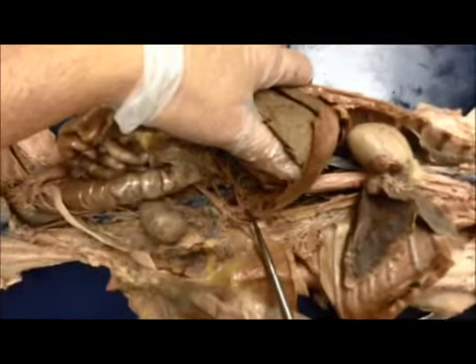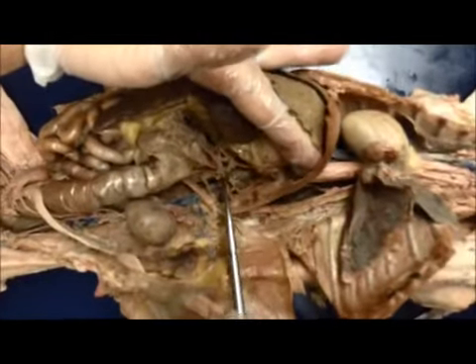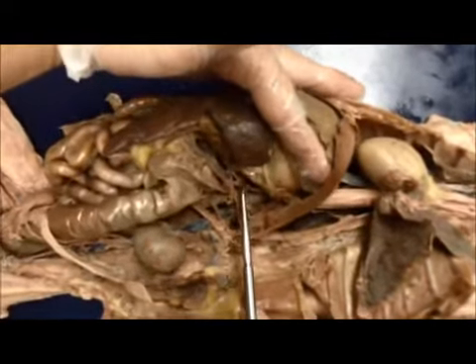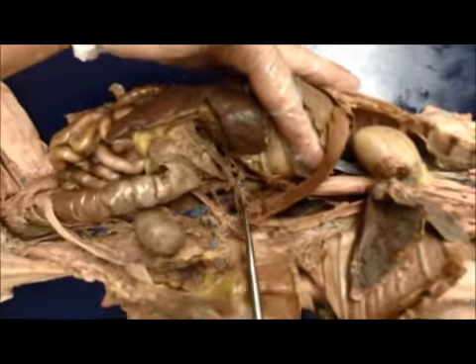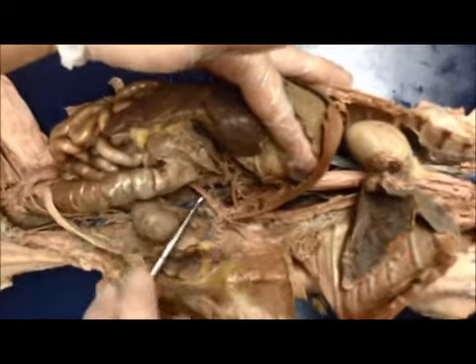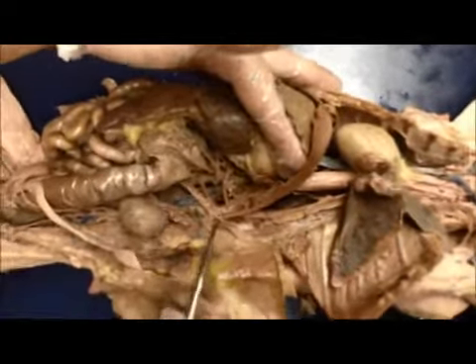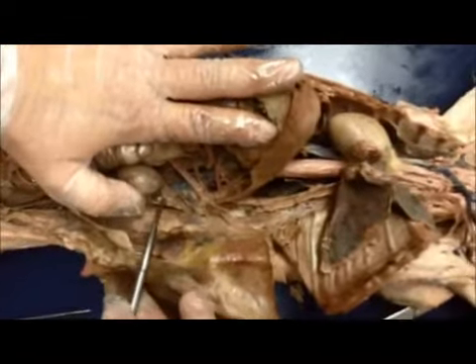This is the celiac trunk. From the celiac trunk, it goes up here. It branches to the right. The first one is the hepatic, then the gastric, we're talking arteries, and then the splenic artery. Come back down here to the aorta. As you're coming down, the next one is the superior mesenteric artery right here. Continue to follow down. You end up at the renal artery.